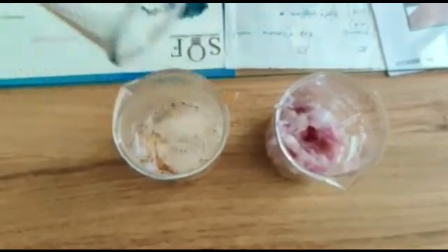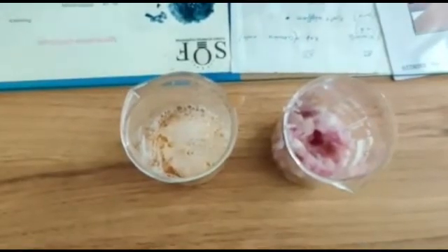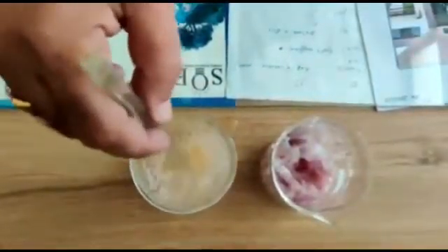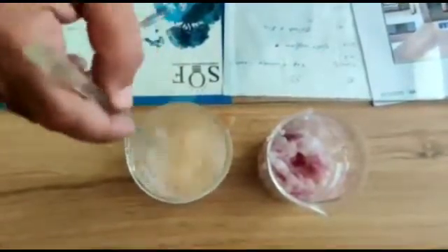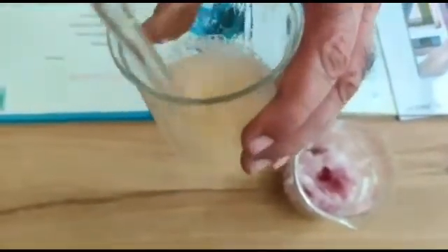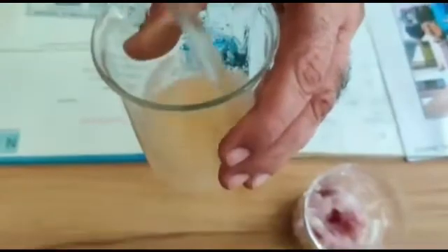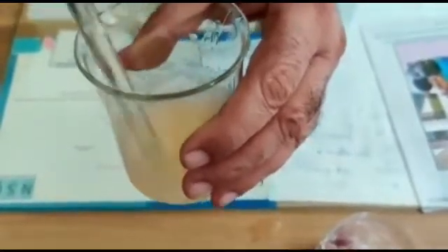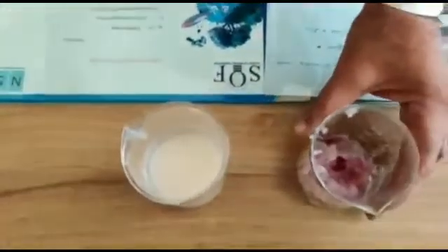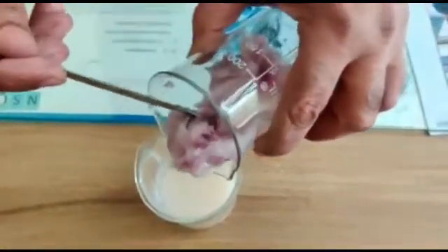With the help of a stirrer or glass rod, we have to stir it. Mix it properly. And after mixing, add the contents of the ground onion here.